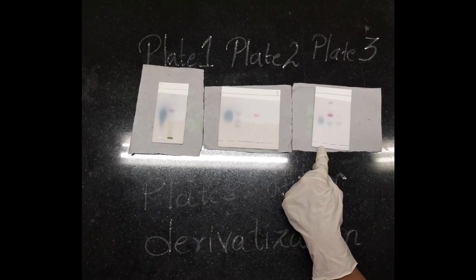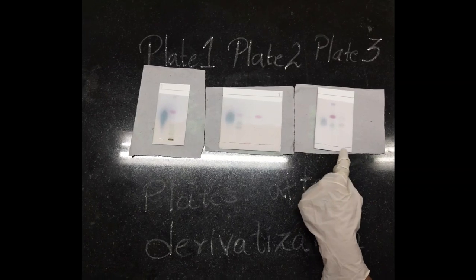Next is plate 3. First band is for standard, next is pudin hara, and last is for ointment.